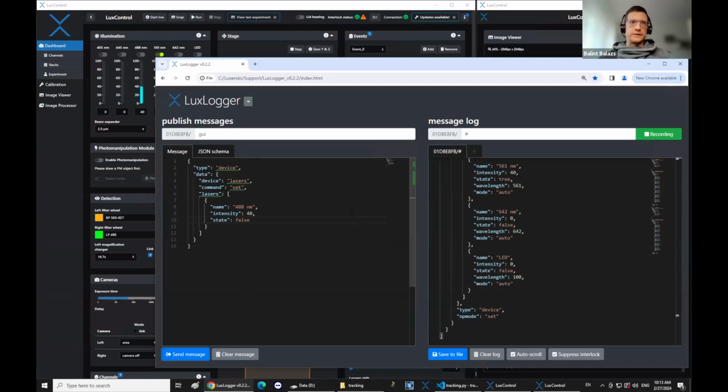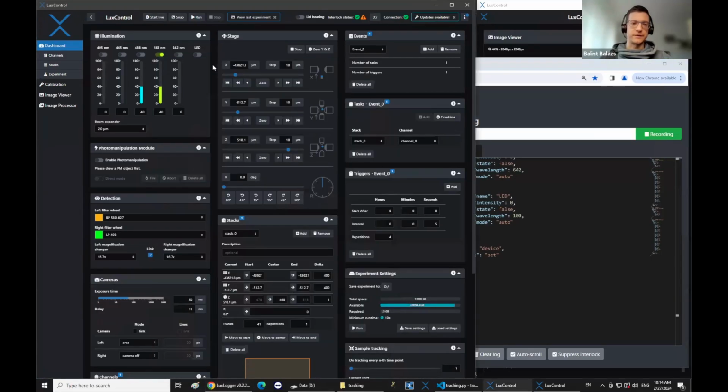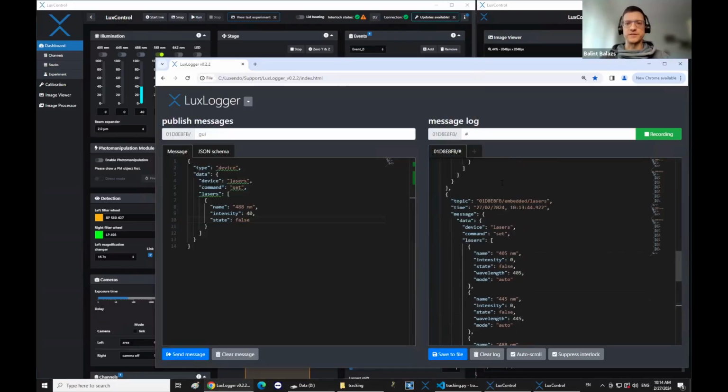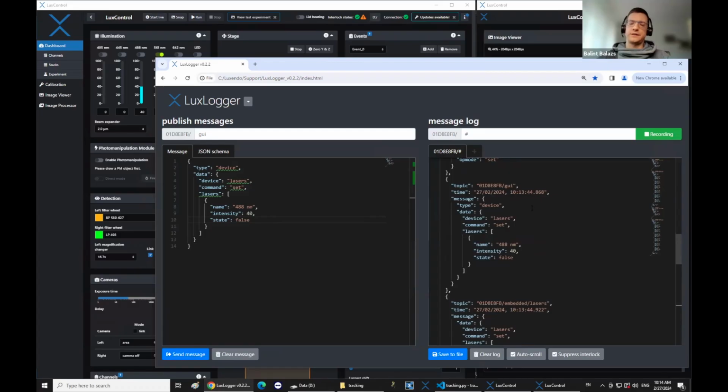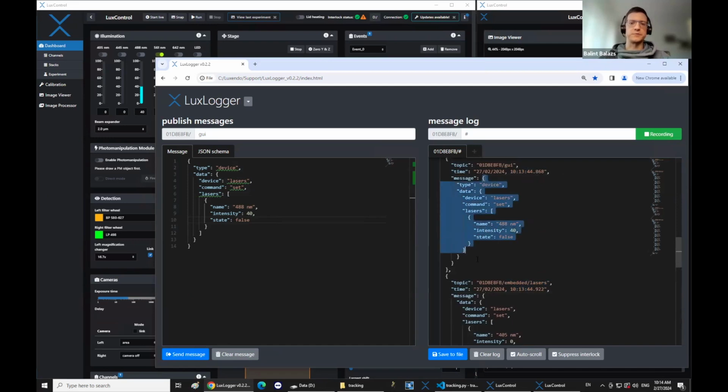So hopefully the concept is clear. Basically, you can just click around, see all the messages, and then copy it in your script, and then build basically any pipeline that you can think of that's basically supported by the GUI. So as long as you can achieve it by a sequence of GUI clicks, you can see the messages, and your script will need to parse the incoming messages from the components, mostly the microscope, and send the messages to control the microscope.